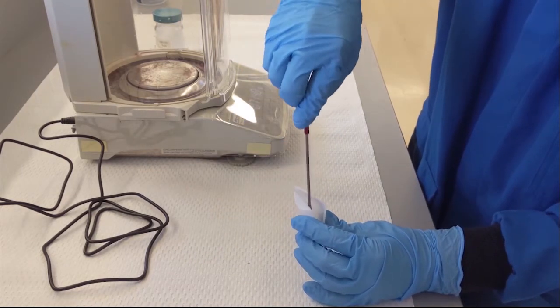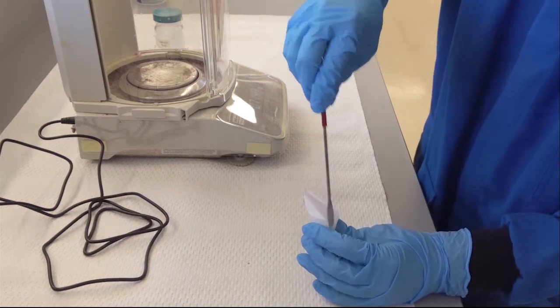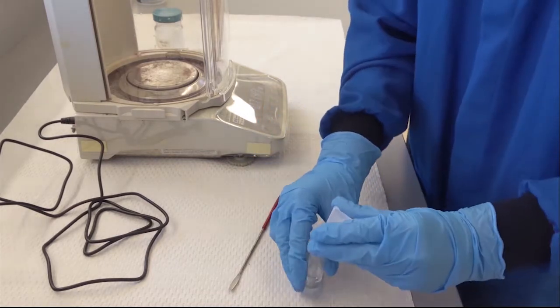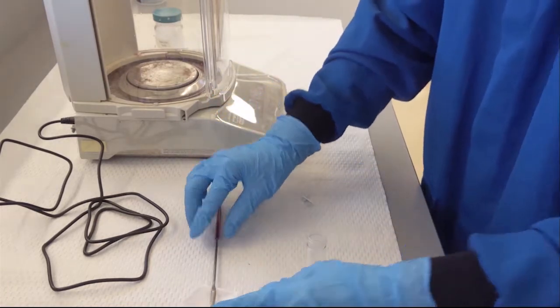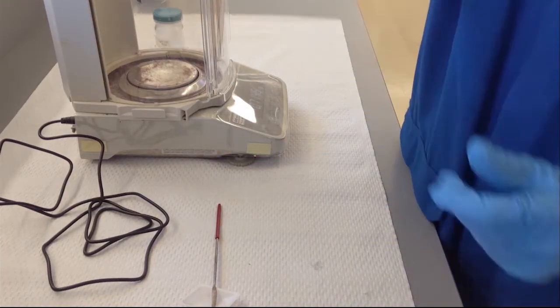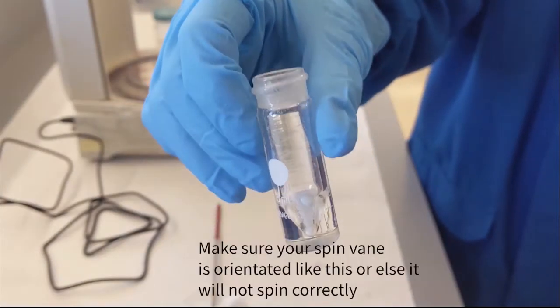Make sure that the vial is dry. Make sure the triangular magnetic spin vane is sitting properly at the bottom of the conical vial.